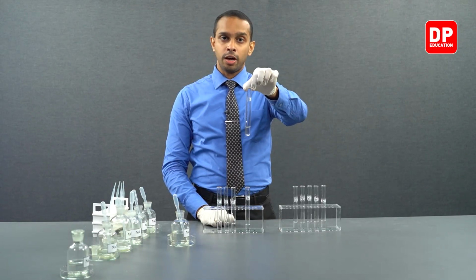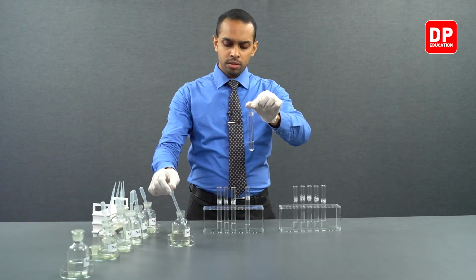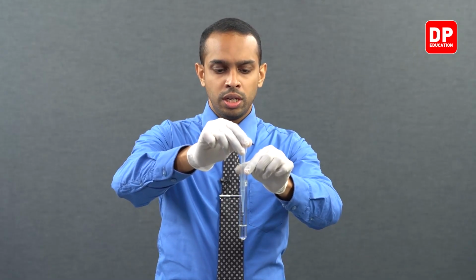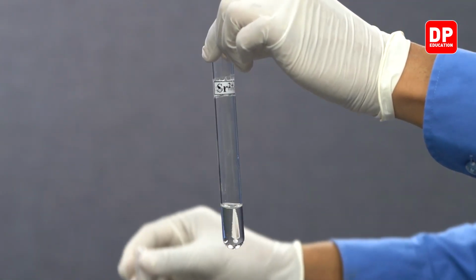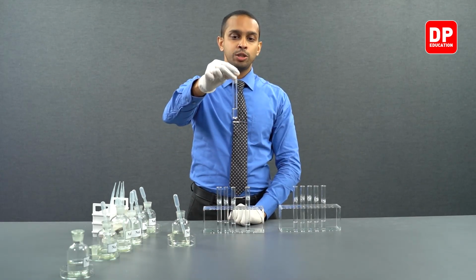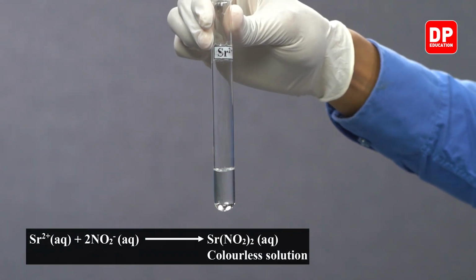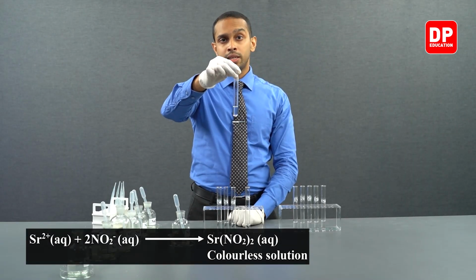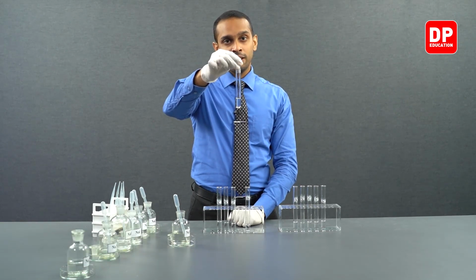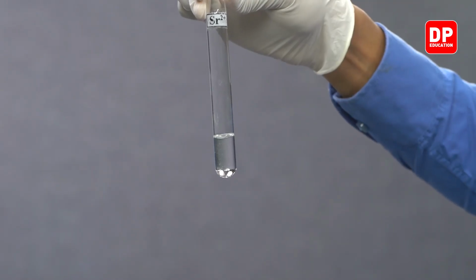Over here, we have our strontium 2 plus aqueous ion solution. Let's add a small amount of sodium nitrite. When we introduce nitrite ions into a strontium 2 plus ion solution, we form strontium nitrite. Strontium nitrite is soluble in water, so therefore you will not see the formation of a precipitate. As you can see, we have a clear solution, no precipitate formed.